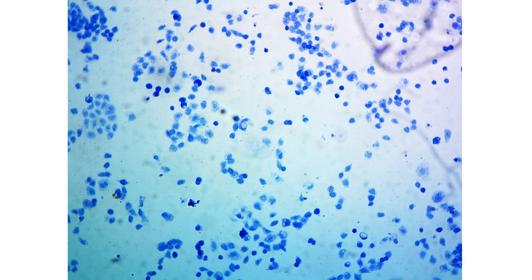So that would be the confluency of this particular culture. If you go back over here, just to remind you, this is a higher magnification. You can see the cells a little bit better here, and that tells you that too. Different cells are different sizes as well. So some cells look a lot more clear at 40x than others.